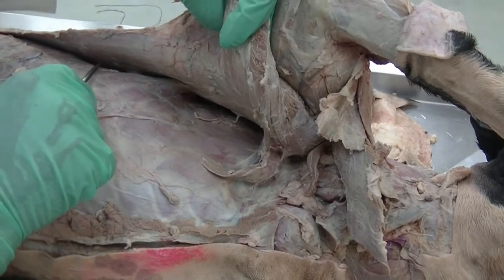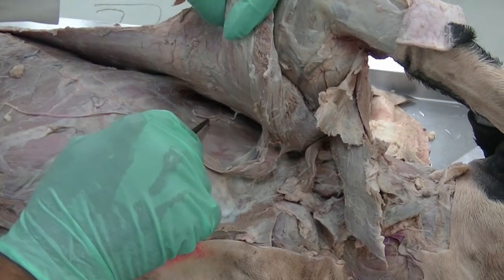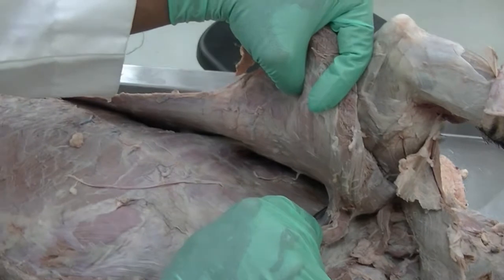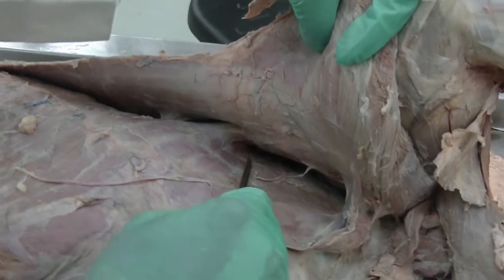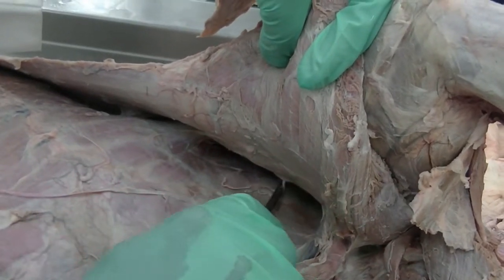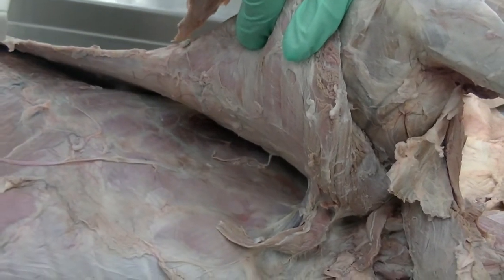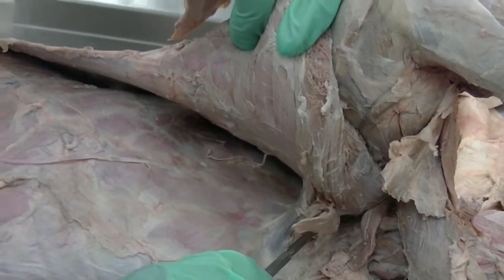The part of the muscle which is present on the thorax is called serratus ventralis thoracis, and the part of the muscle which is present on the neck, specifically on the cervical vertebrae, is the serratus ventralis cervicis or cervicalis. So this is your serratus ventralis muscle. After transecting the serratus ventralis muscle and rest of the extrinsic muscles, we should be able to take the forelimb completely off the body after we cut the blood vessels and nerves which are coming into or going towards the forelimb.